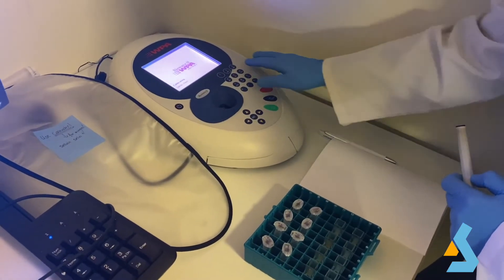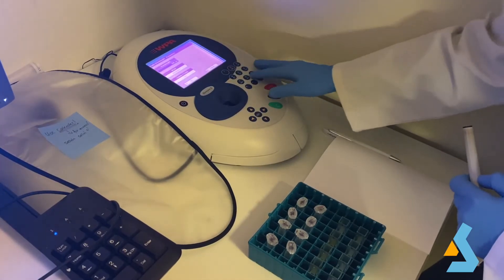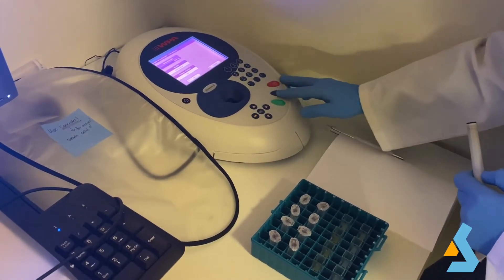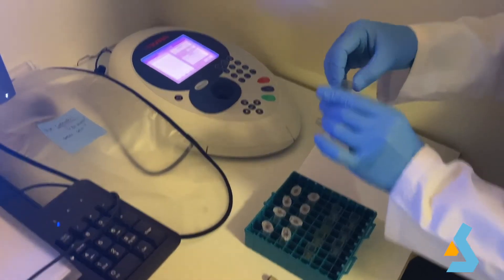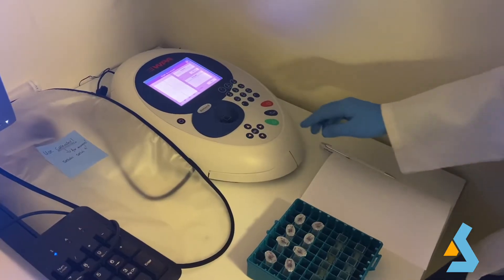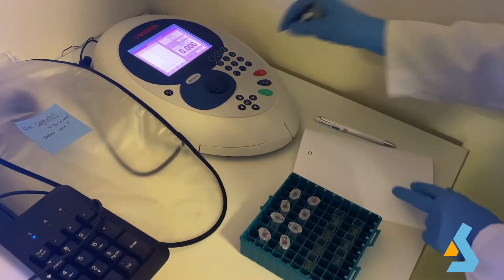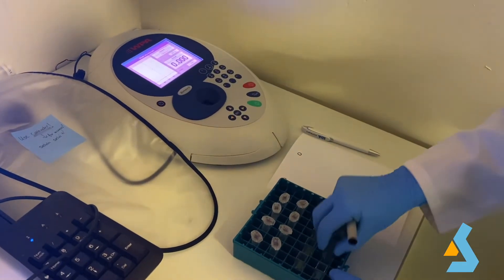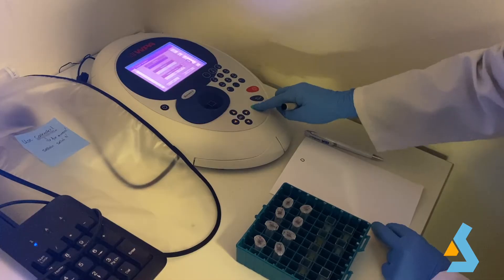Turn on the UV-Vis spectrophotometer and choose applications and single wavelength. Enter the wavelength as 490 nanometers. Insert the blank — here we use the glucose-free sample as blank. Then measure and record the absorbance of each specimen.